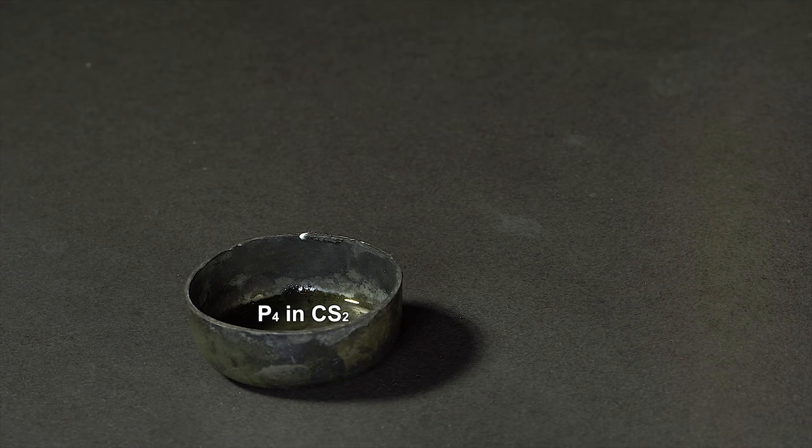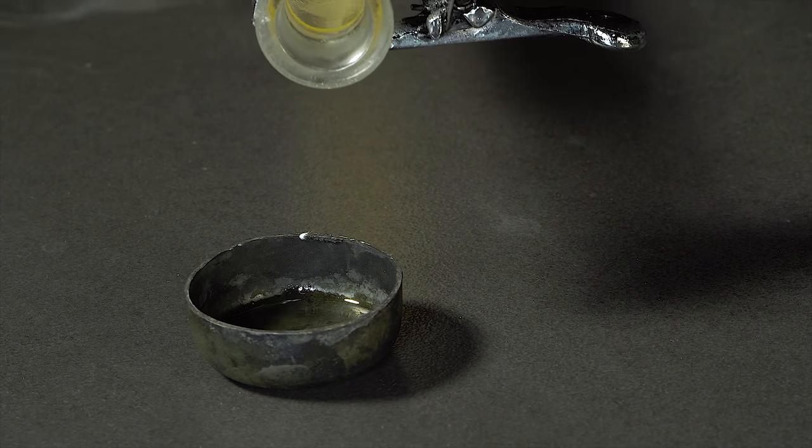It reacts with a solution of white phosphorus and carbon disulfide, where there will be no combustion.